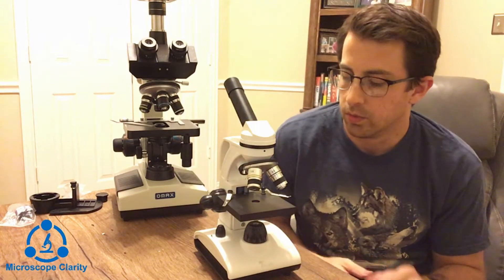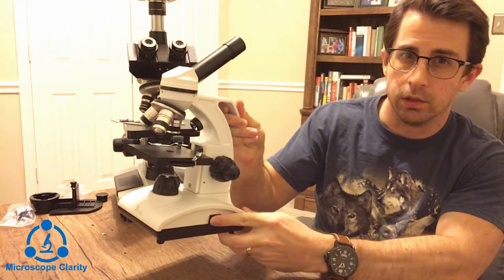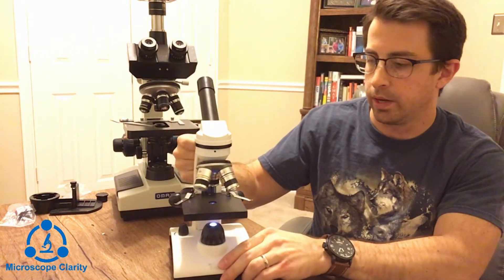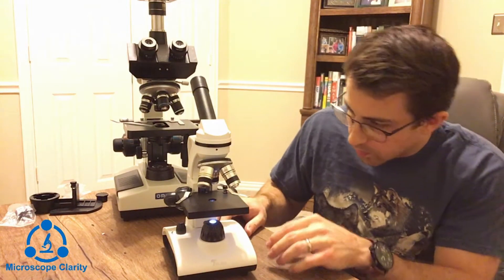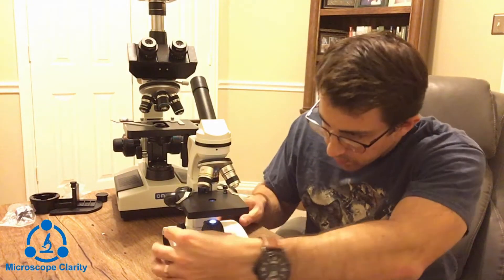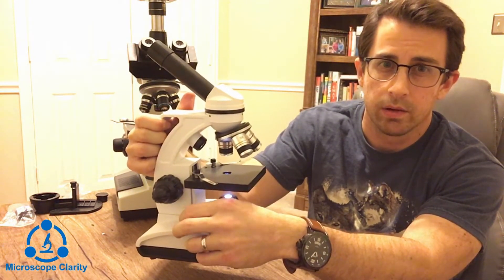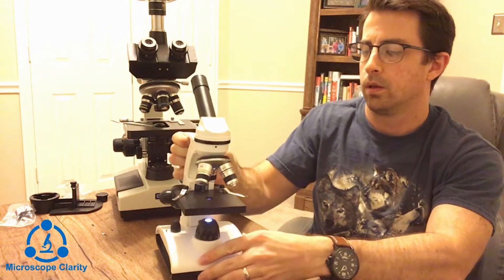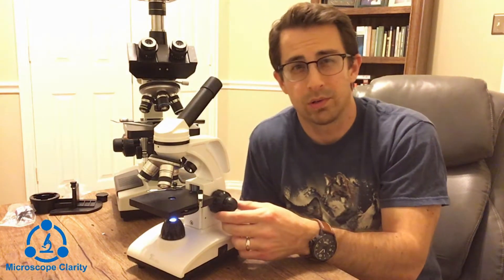Down at the bottom we've got the illuminator switch, which turns on the illuminator at the bottom. We've also got the illuminator intensity knob, so you can raise or lower the intensity of the illuminator. On the sides we've got the coarse and fine focus knobs.